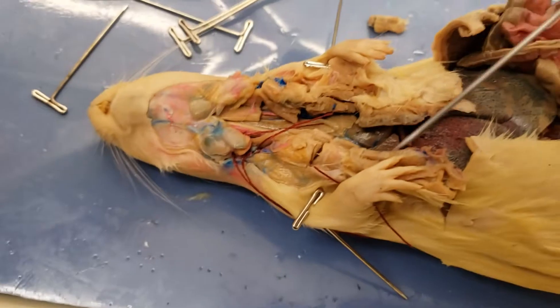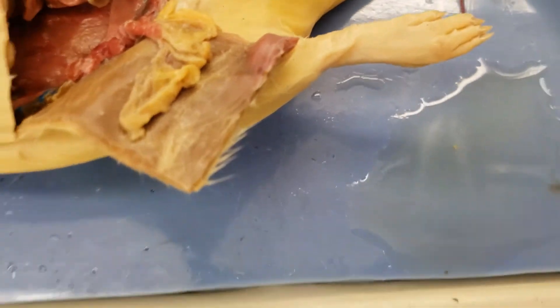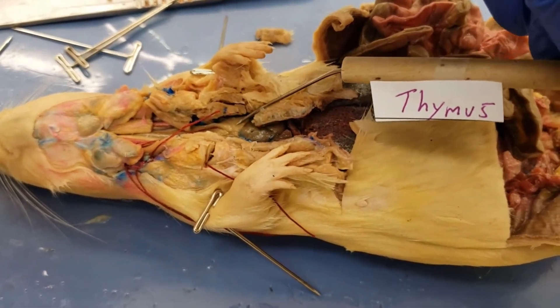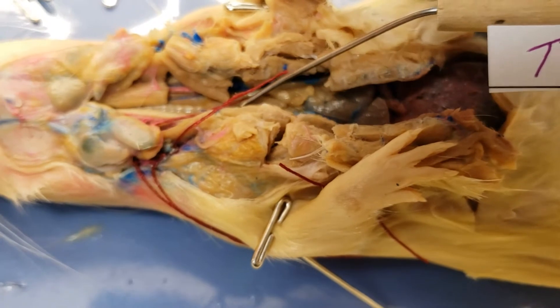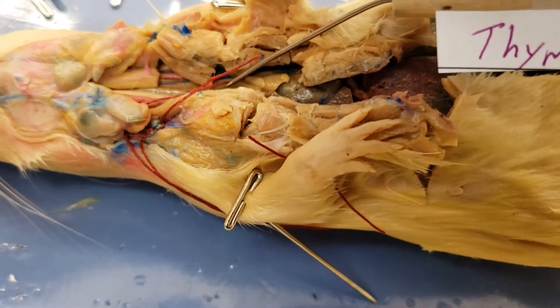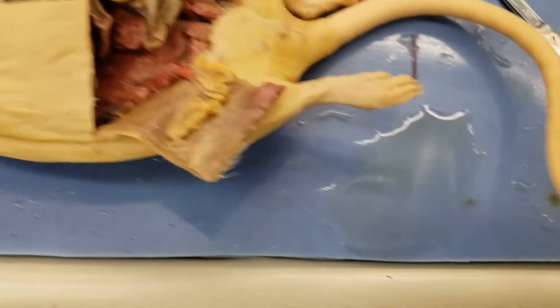But that is the trachea. Next up, let's hit the thymus. The thymus is involved in the endocrine system. The thymus is this little rascal right there — that's our thymus. If we zoom in a bit, it lays on top of the heart. It's a site where certain immune cells will go to further their development and get exposed to pathogens. It has an immune system role. But that's the thymus, and that's also an A&P 2 subject.